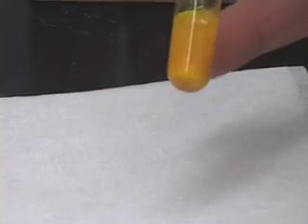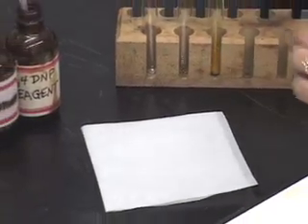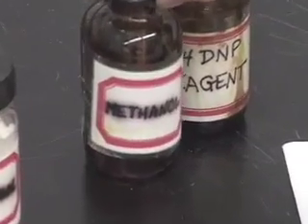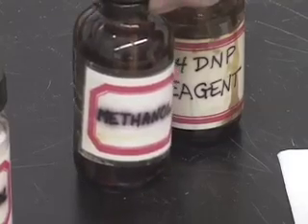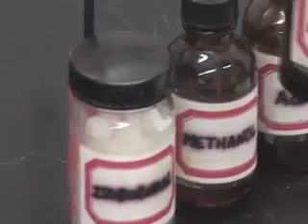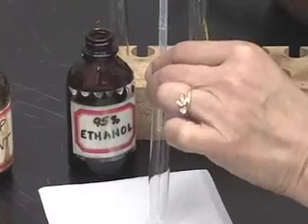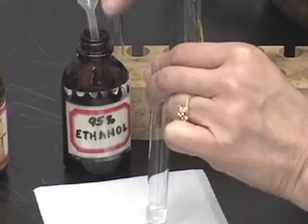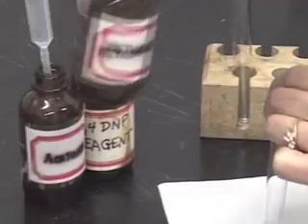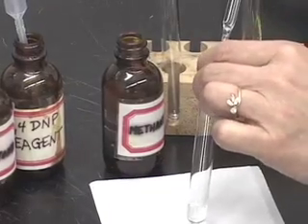This indicates that the compound tested is either a ketone or an aldehyde, and since we tested acetone, which is a ketone, this is a positive test result. Next, I am going to test methanol. As the name indicates, methanol is an alcohol, so we expect the test result to be negative. First, add 1 ml of 95% ethanol to a test tube, then 5 drops of methanol.